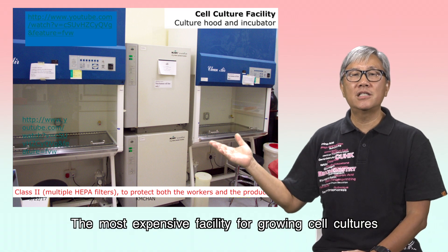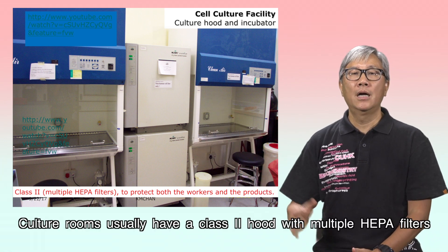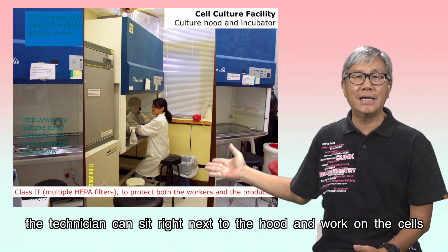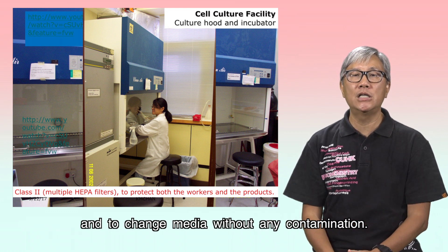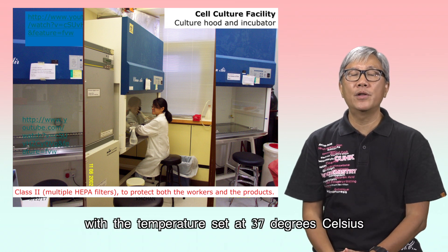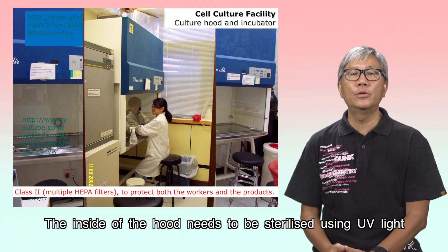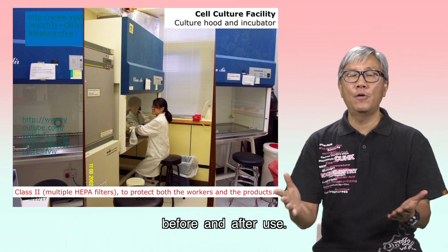The most expensive facility for growing cell cultures is the culture room, which includes a culture hood and incubator. Culture rooms usually have a class 2 hood with multiple HEPA filters to protect the lab workers and the cultured products. As you can see here, the technician can sit right next to the hood and work on the cells and change media without any contamination. In the middle, you can see two incubators with closed doors — temperature set to 37 degrees Celsius for mammalian cells and 28 degrees Celsius for fish cells or insect cells. The inside of the hood needs to be sterilized using UV light and cleaned with alcohol from the wash bottle before and after use.